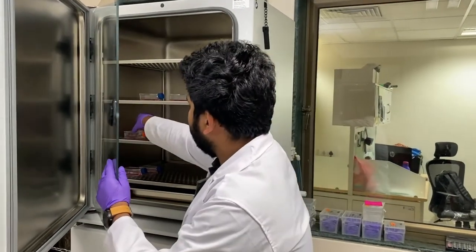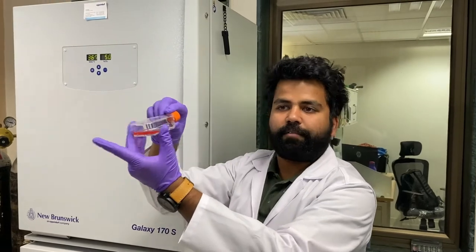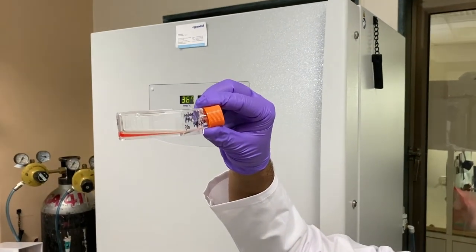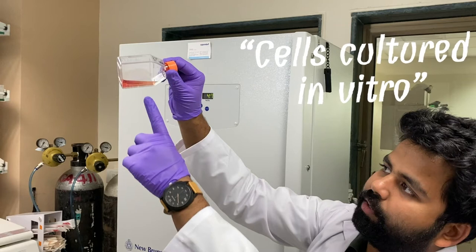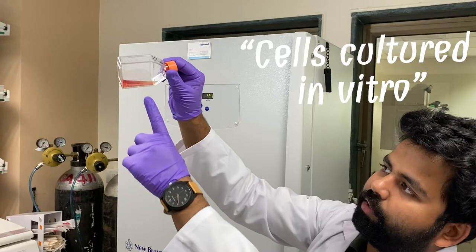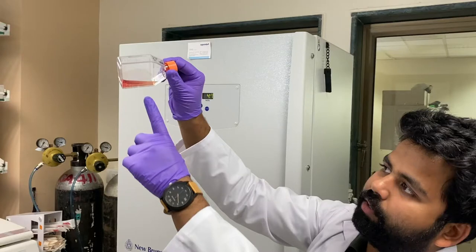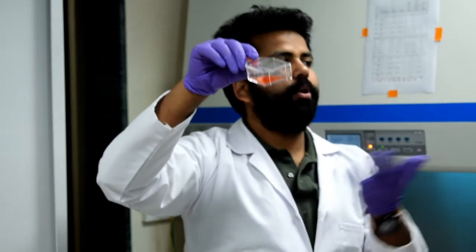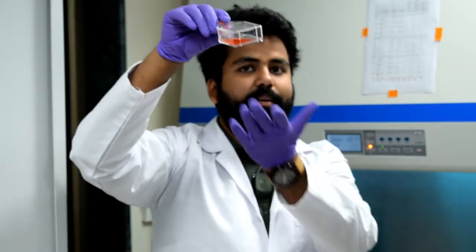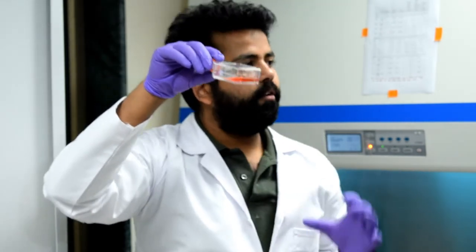What I did earlier was splitting cells. Here is a cultured flask where cells are growing — if you compare it against the light you can see the bottom region is a bit cloudy, which is how cells appear under light. They spread across the surface, and once they have covered it, we need to give them more space to continue growing.